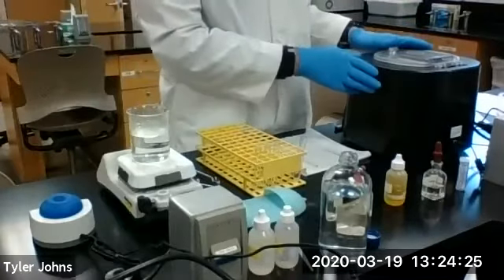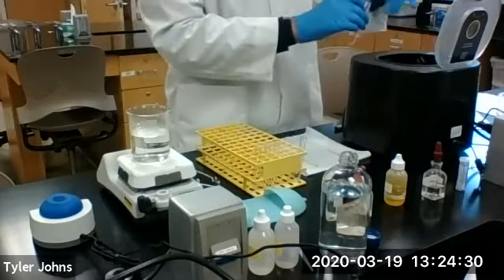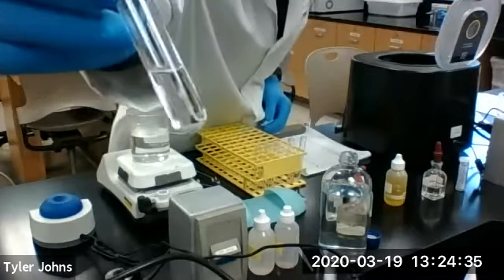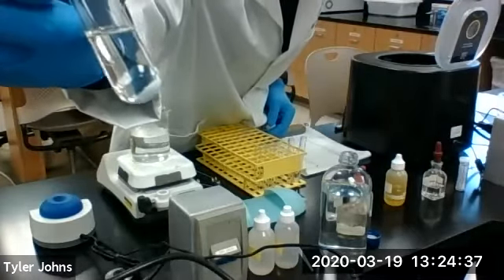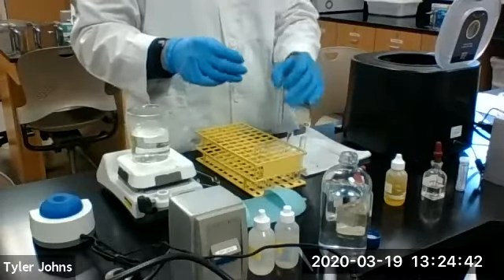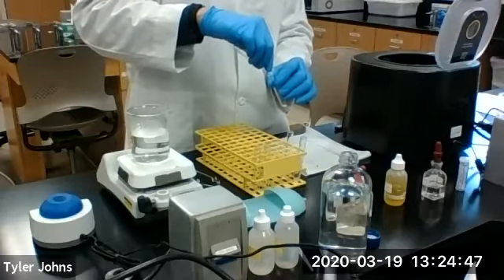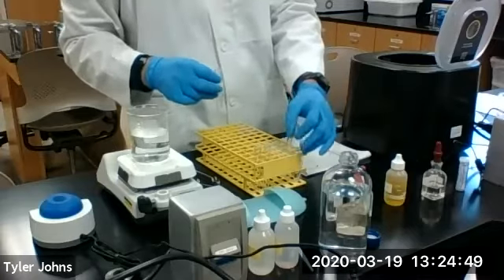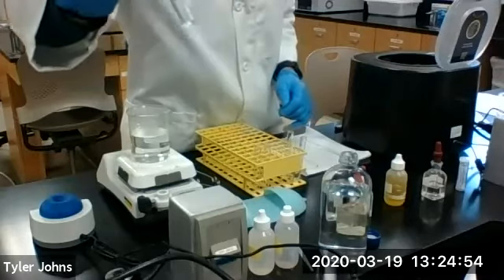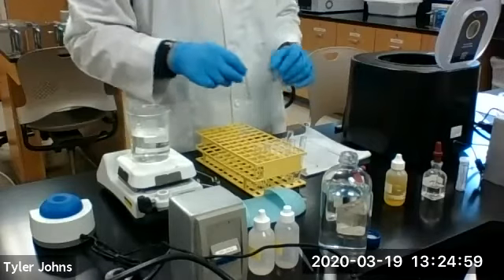Okay, so our centrifuge is stopped. We're going to remove our tube. You can see the precipitate has centrifuged down. We're going to discard the wash. After discarding the wash, our precipitate, or residue 1, R1, is now ready for further analysis of the lead and silver ions.